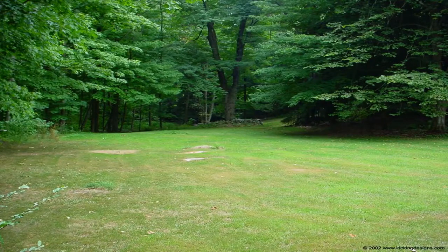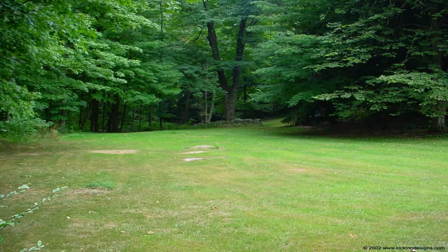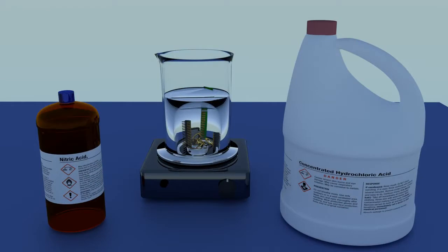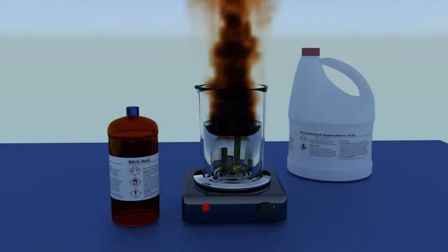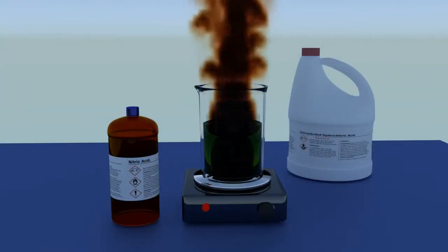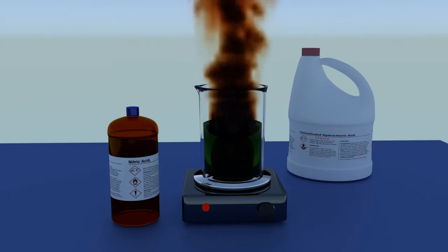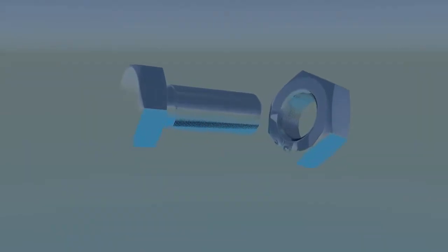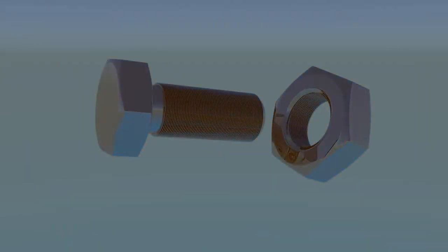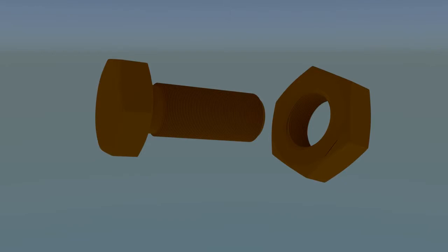It is advisable to refine your gold outdoors. The traditional form of aqua regia is a combination of nitric and hydrochloric acid. Nitric acid is very hazardous. When combined with hydrochloric and metal it produces prodigious amounts of brown, very corrosive, toxic gases including nitric oxide. These fumes are so corrosive that they will rust even high-grade stainless steel after less than one second of exposure.